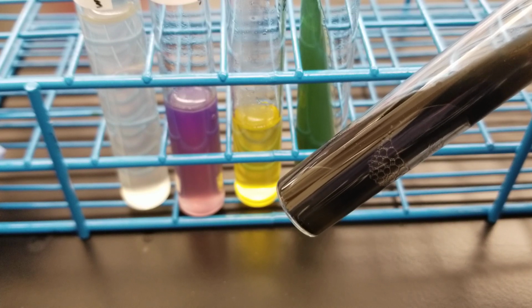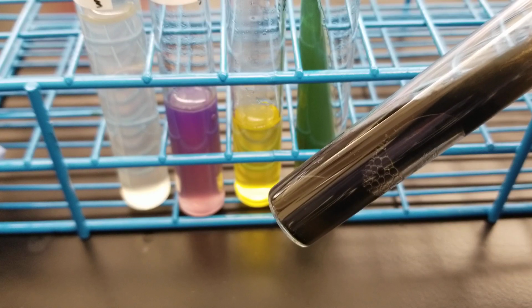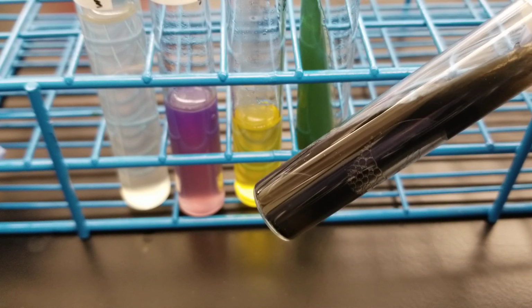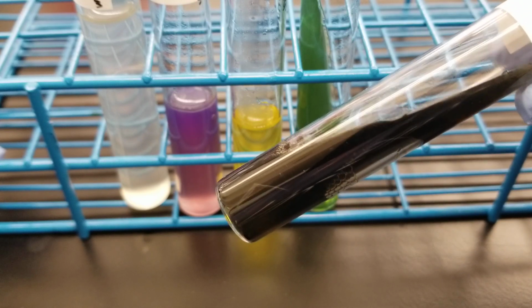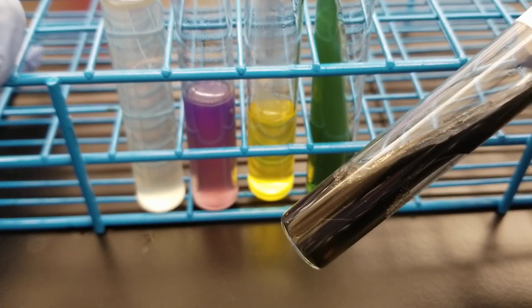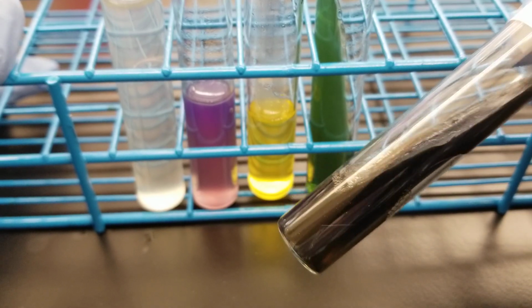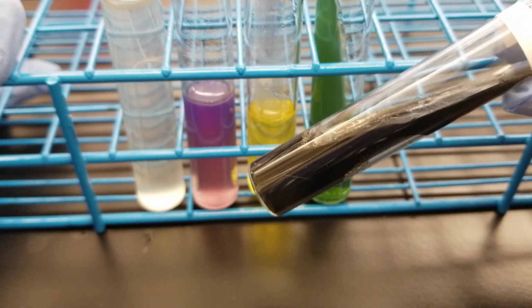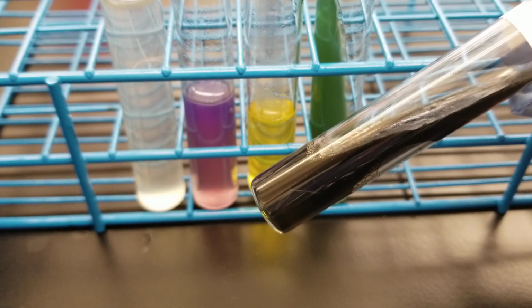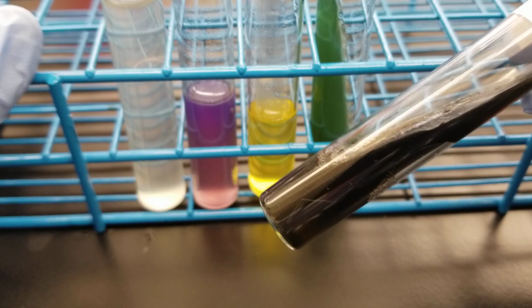It does have gas, and I believe this is one of the ones that we got as a new strain, so this may not be the same as what we have seen before in our lab. At the beginning of the semester, we had an awful experience where we lost practically all of our organisms, and so we got new strains, so that's why we're making this video, to show what the typical results would be for these new organisms. And there's been a mixture of them, so I'm just doing them all. We didn't get Morganella morganii yet. We lost that one as well.